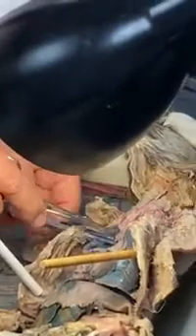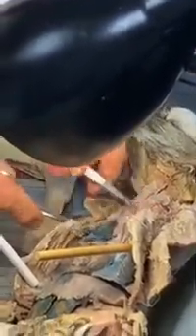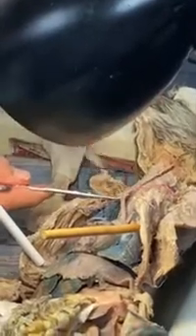Okay. There's the aortic arch. What are the two branches in the aortic arch? In the cat, remember two branches in the cat. There they are. Brachiocephalic and left subclavian. Branches of the subclavian. Look, 1, 2, 3. There they are. Isn't that cool? Look at that.